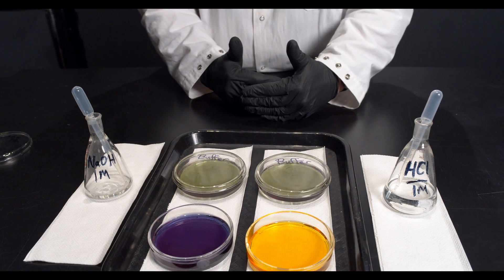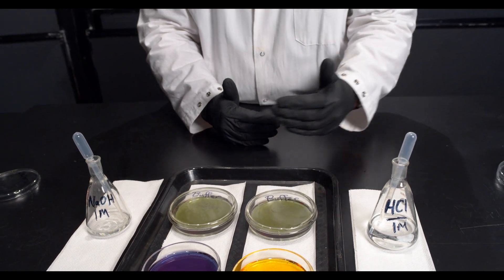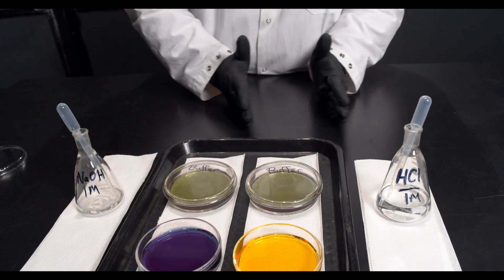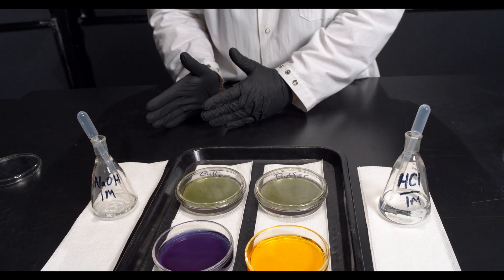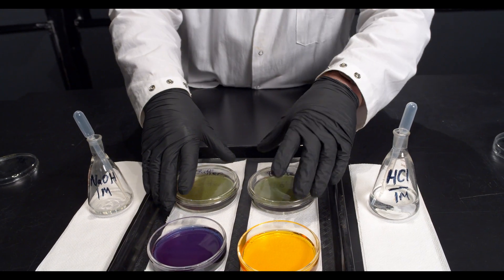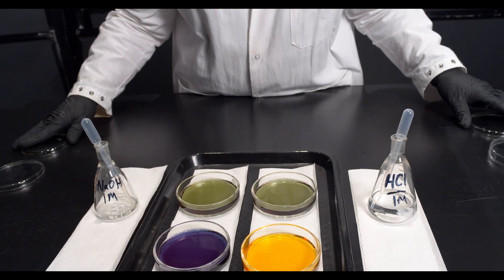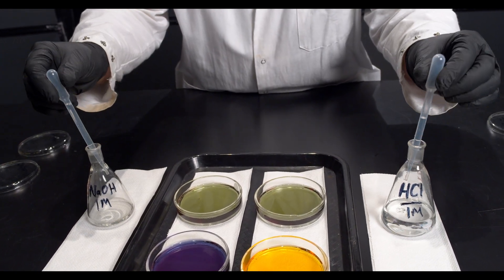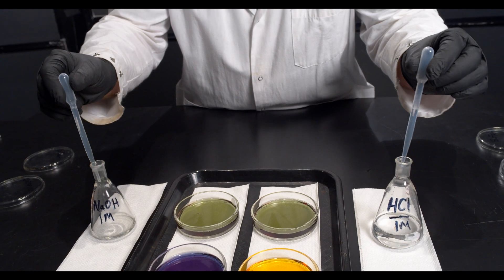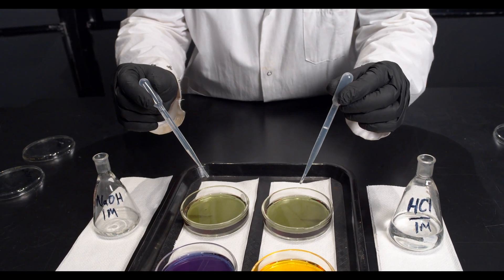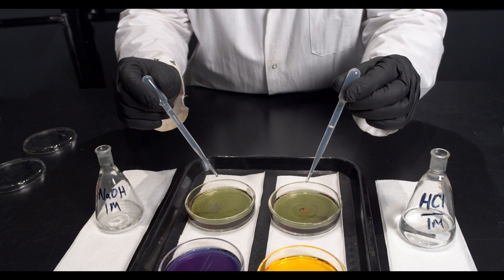So I'm going to do the same addition of a single drop of acid and base to compare.